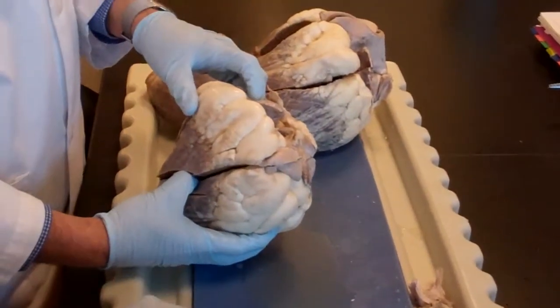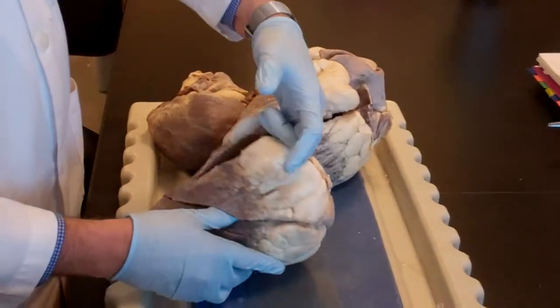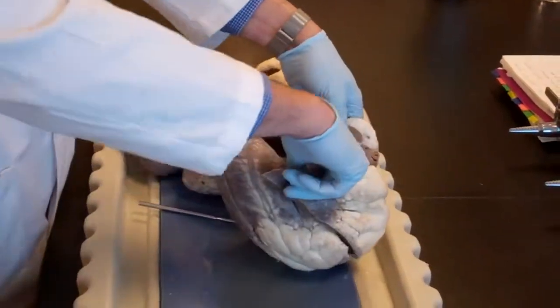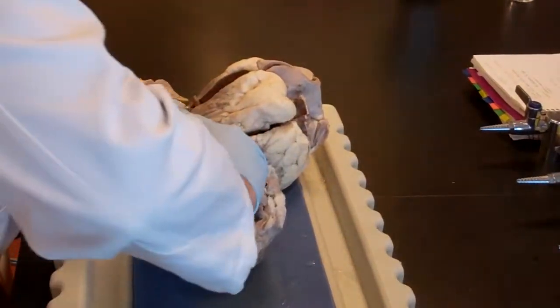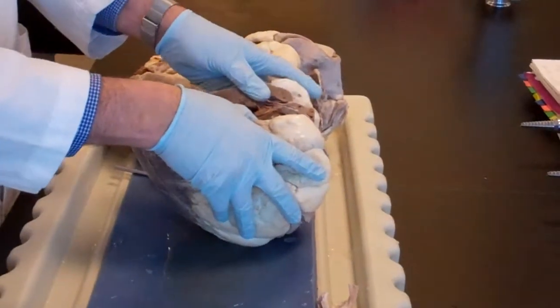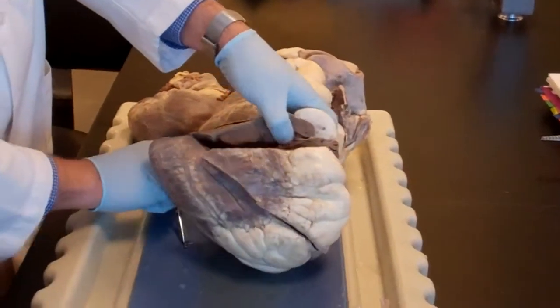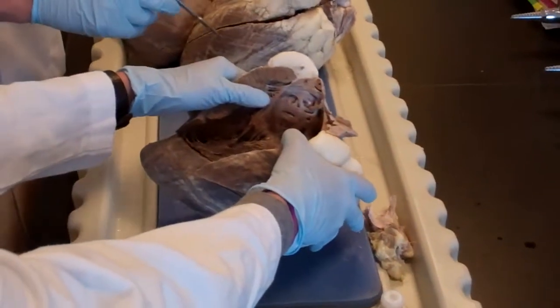You go to the right-hand side, and we're going to do the same thing. Okay. Go through the auricle, and I am in the cavity of the right atrium. Okay. See the right atrium? I'm there. Okay. So I made a boo-boo here, and I went through. All right. And then to show the tricuspid valve that's on the right-hand side. Okay. I had to do this. This is easy. Why is it easy? Why is it easier?